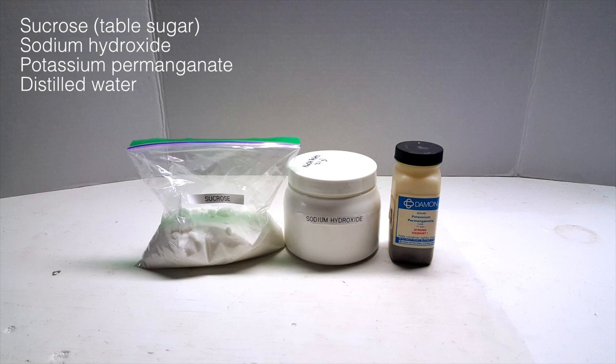Sucrose, or table sugar, sodium hydroxide, which can be found as a drain cleaner, and potassium permanganate, which can also be found as a topical antiseptic. I also used distilled water, which isn't shown here.